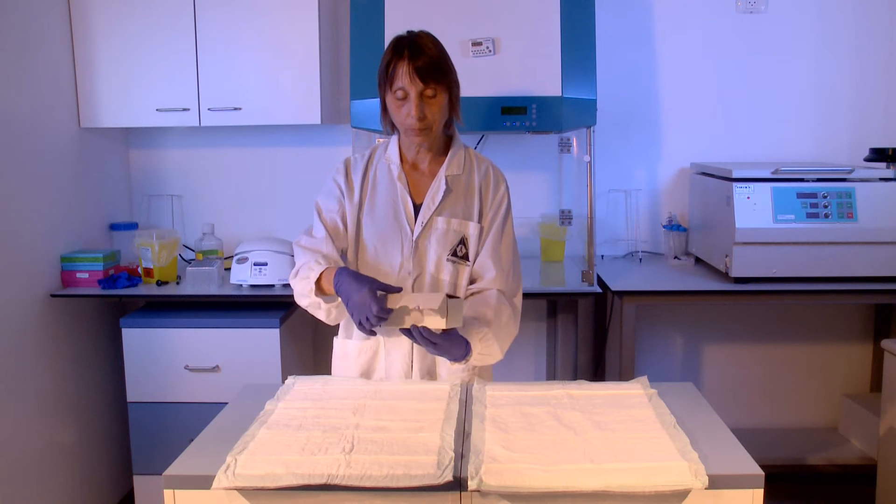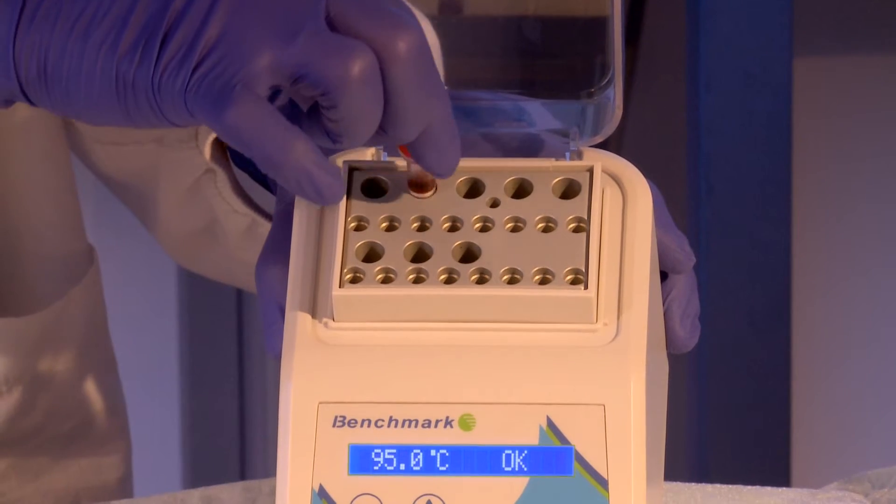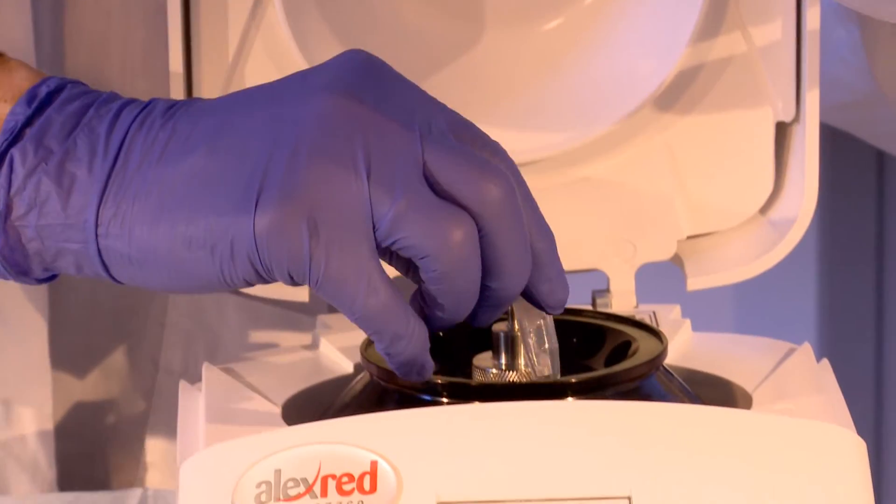We will demonstrate the method for using the PC-RUN DNA Rapid Extraction Kit for the extraction of DNA to be employed with the PC-RUN Molecular Detection Kits.